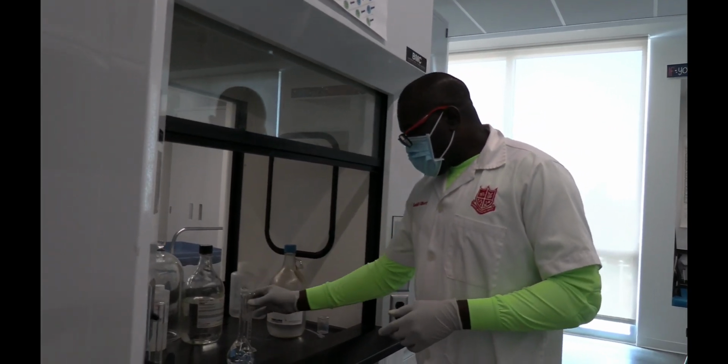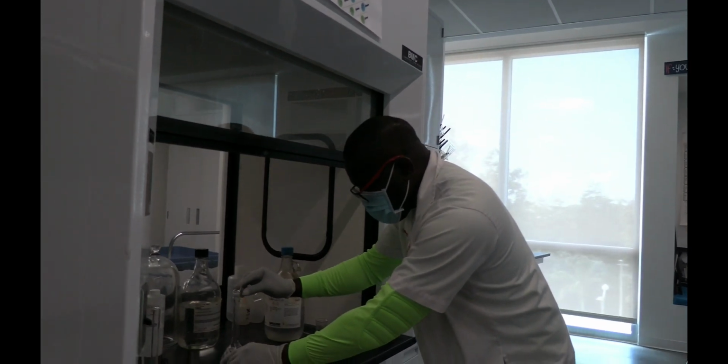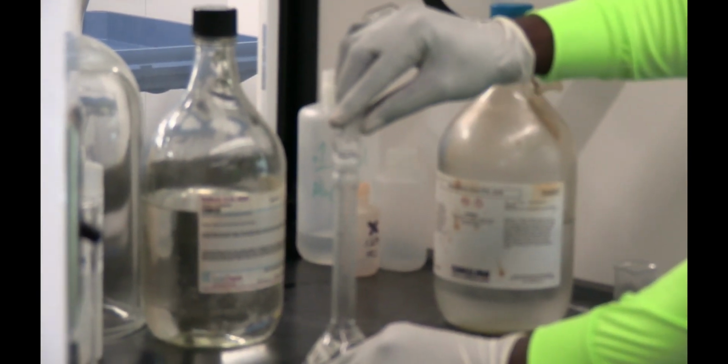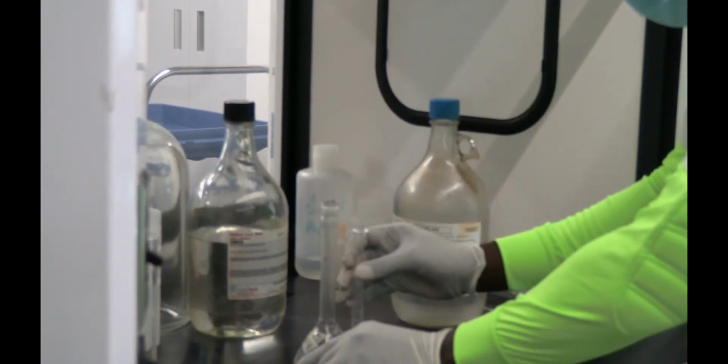Now I'm just going to pour out my acid into this. I'm not even going to use a funnel, which you could use, but this is pretty small, so I don't need to use a funnel. So I'm adding all my acid, as much as I can get. And of course to this you're using distilled water.